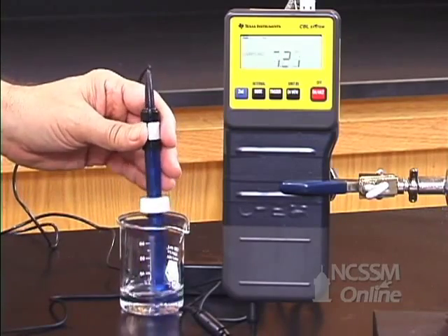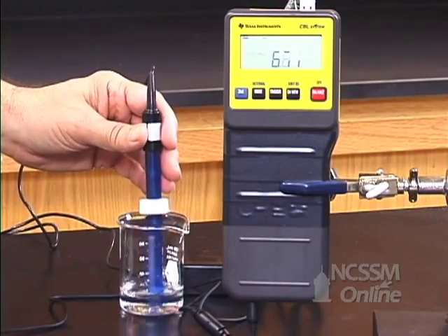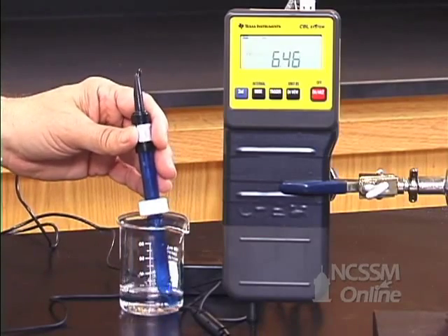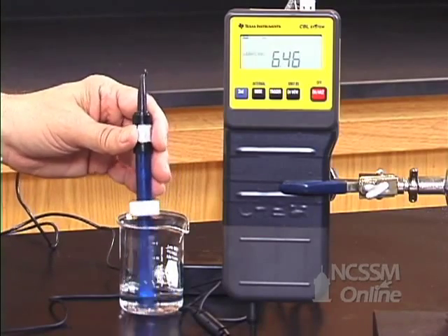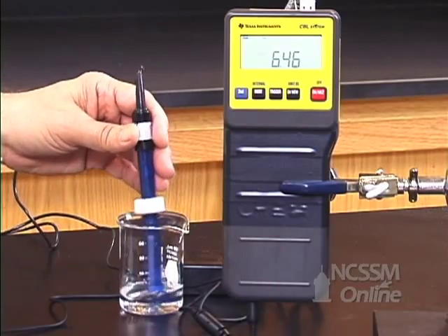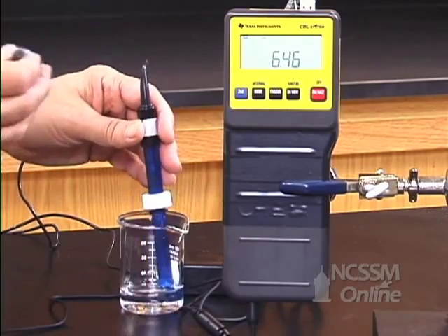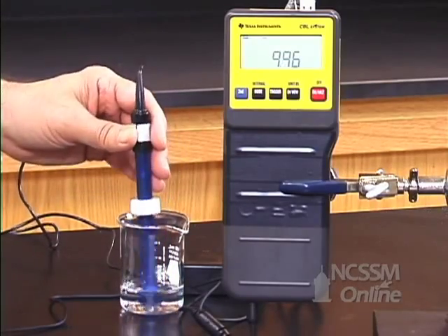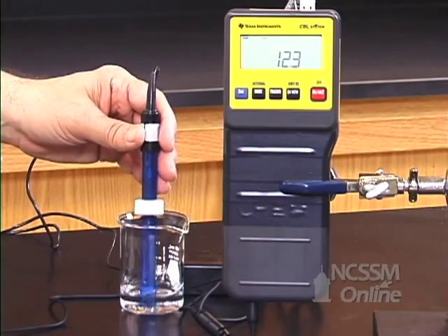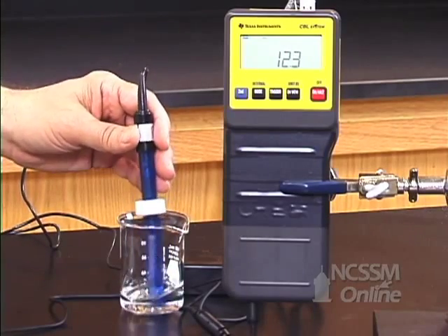I have added 5 drops of the 1 molar sodium hydroxide. Notice that the pH of the solution has risen rapidly. Again, the buffer capacity of the more dilute buffer solution is a lot lower. After adding 10 drops of the 1 molar sodium hydroxide, we have completely destroyed the buffer, and the pH has risen very rapidly.